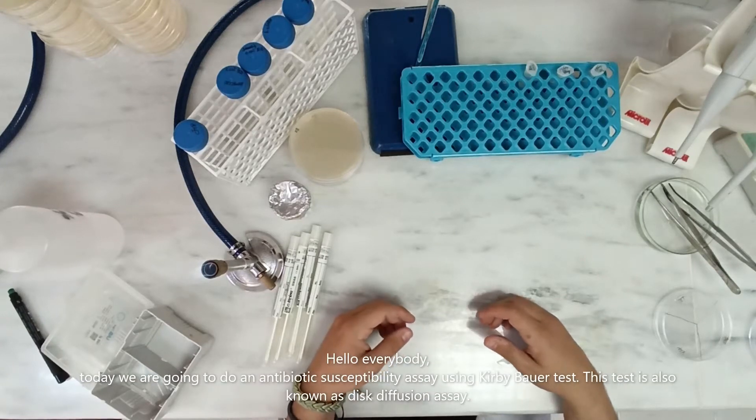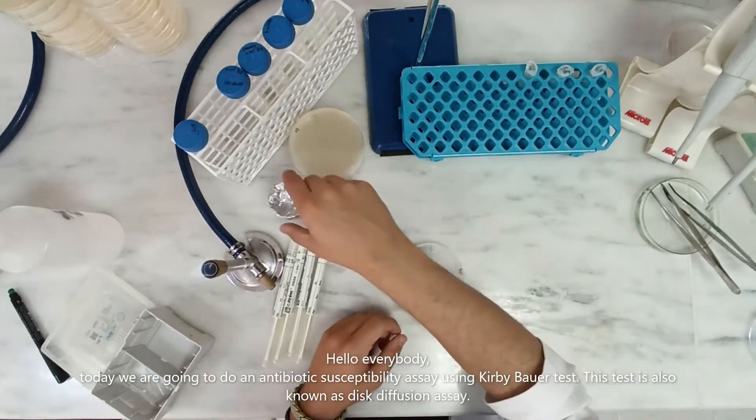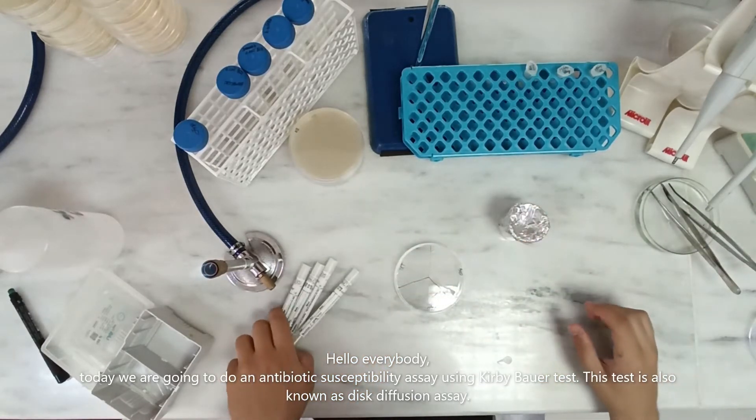Hello everybody. Today we are going to do an antibiotic-susceptibility assay using the Kirby-Bauer test. This test is also known as Disc Diffusion Assay.